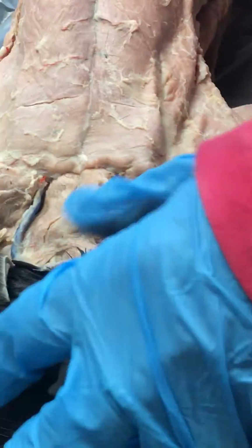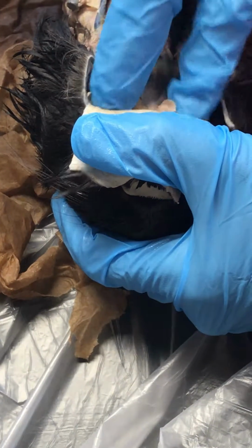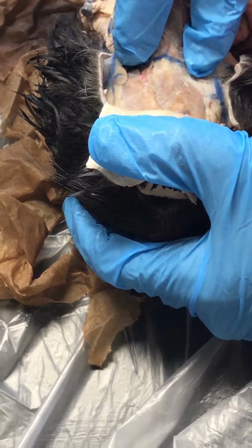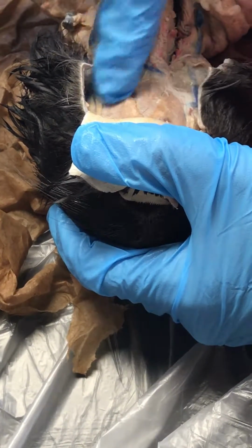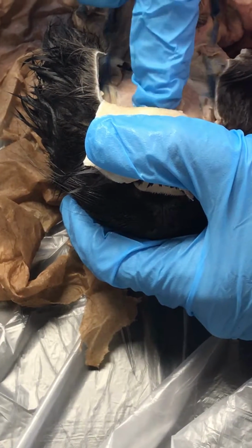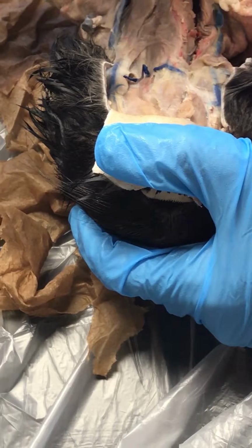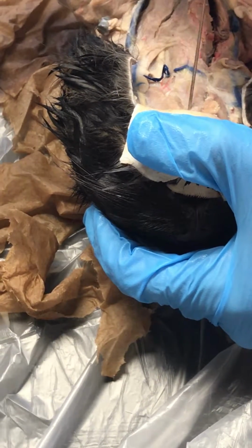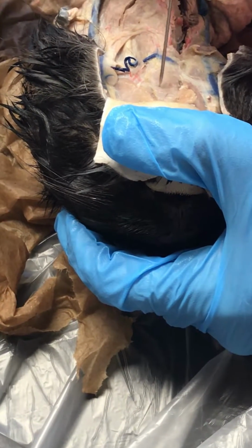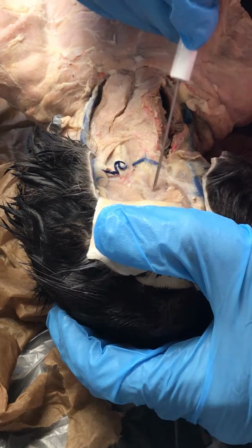Alrighty. Then we come up underneath here, and you have the digastric. The digastric actually makes an upside down V if you're looking at it from this direction. You have muscle coming from the left and the right, and it comes up under the chin into a V. So here's your digastric on each end. And then in the middle of the digastric, above the transverse jugular, is the mylohyoid. So digastric and then the mylohyoid.